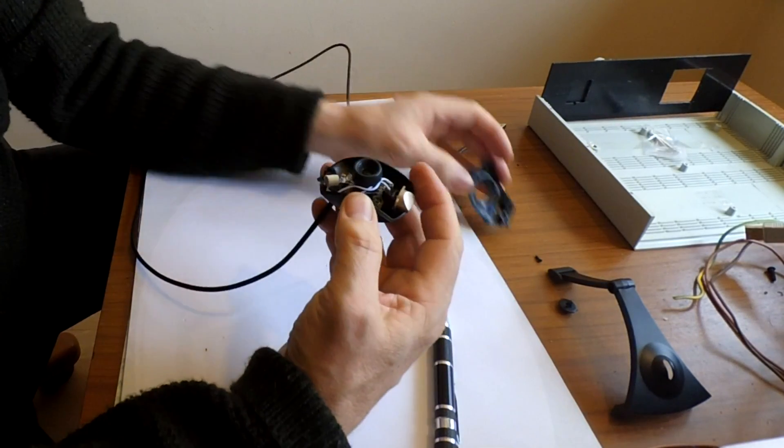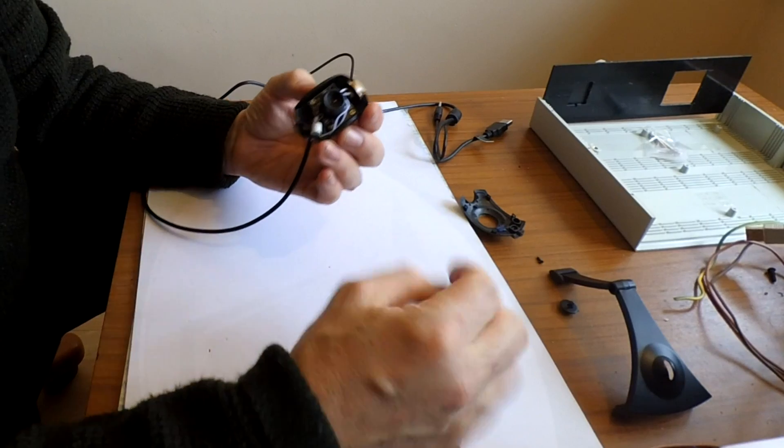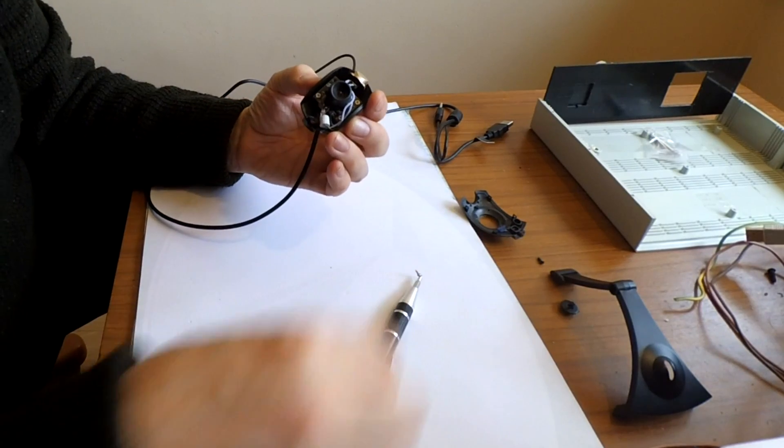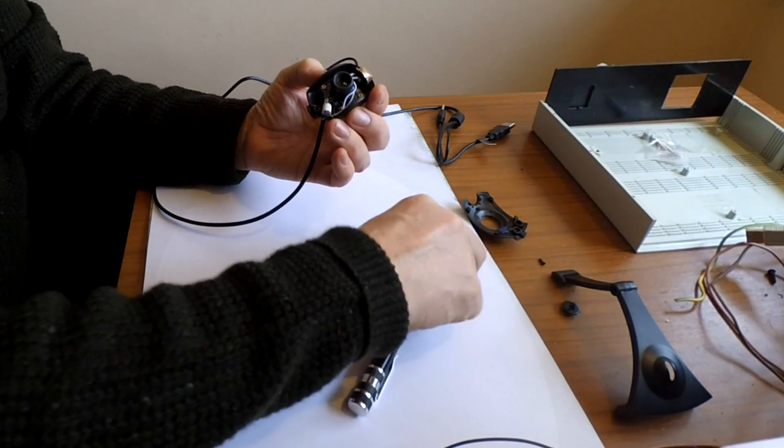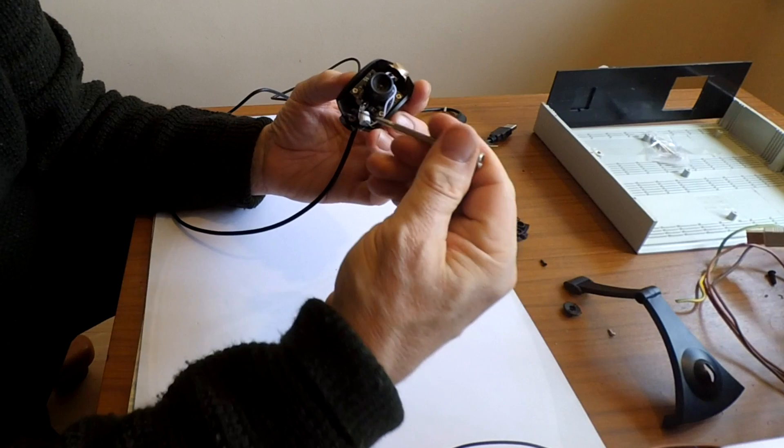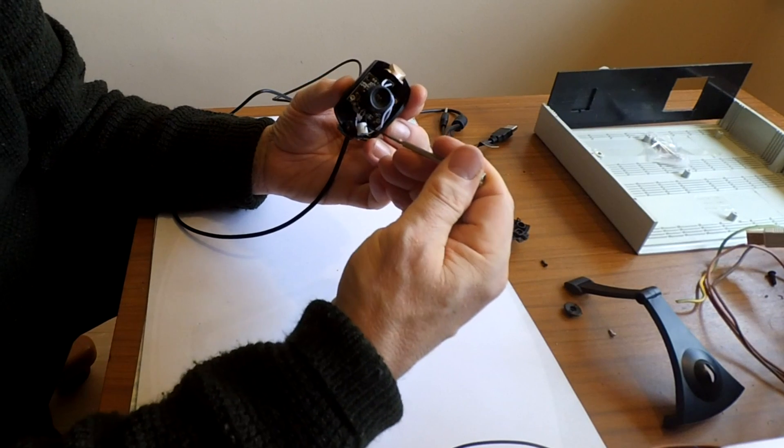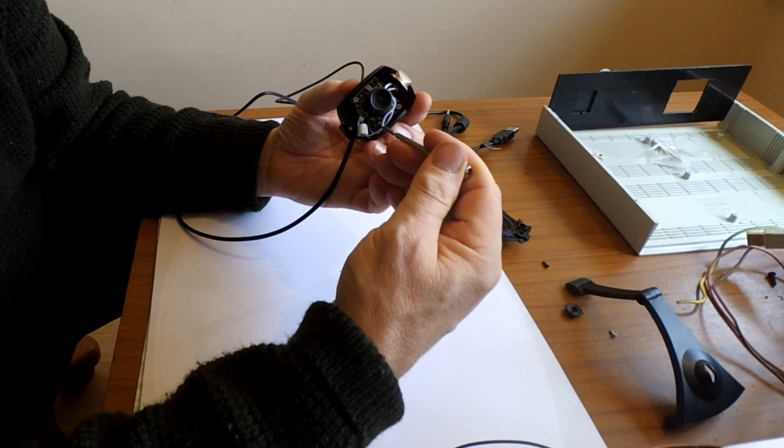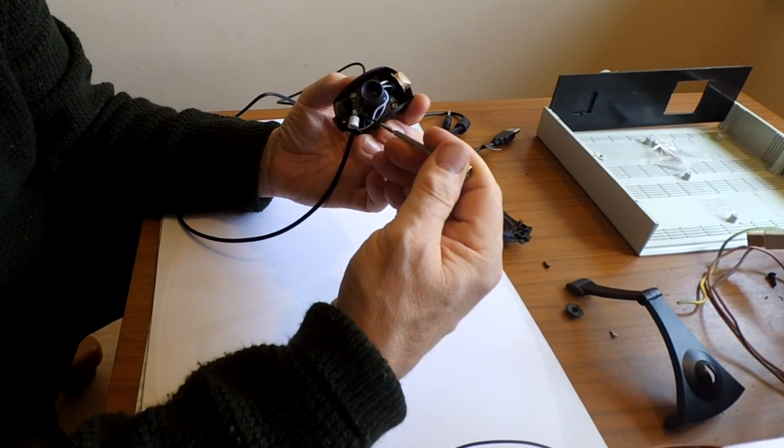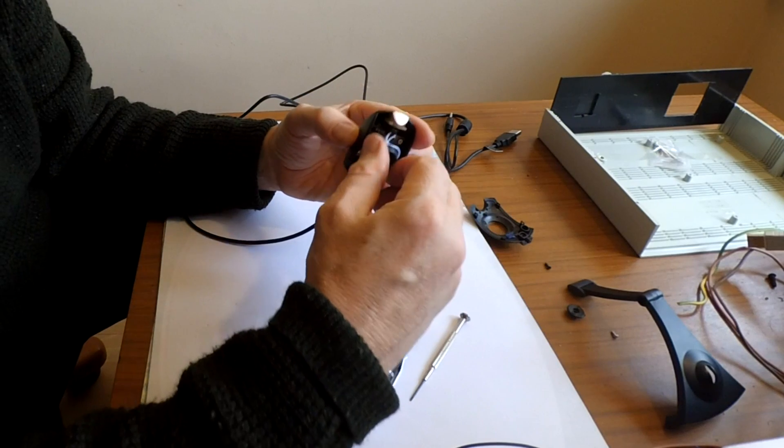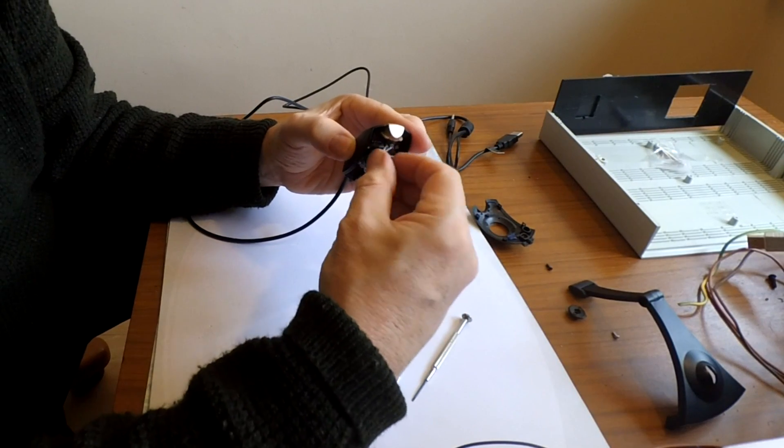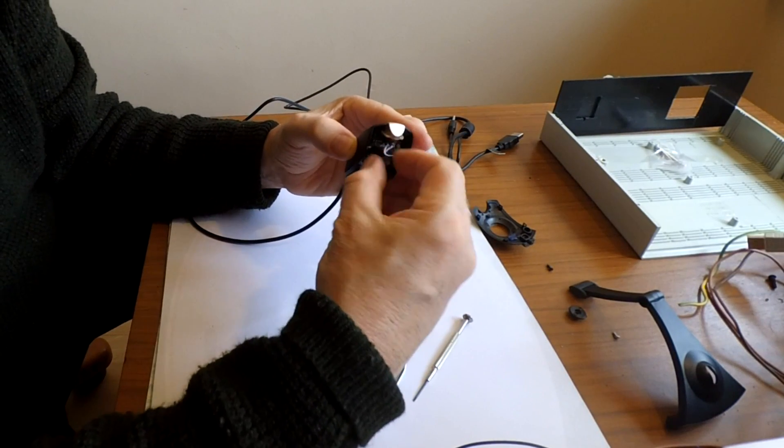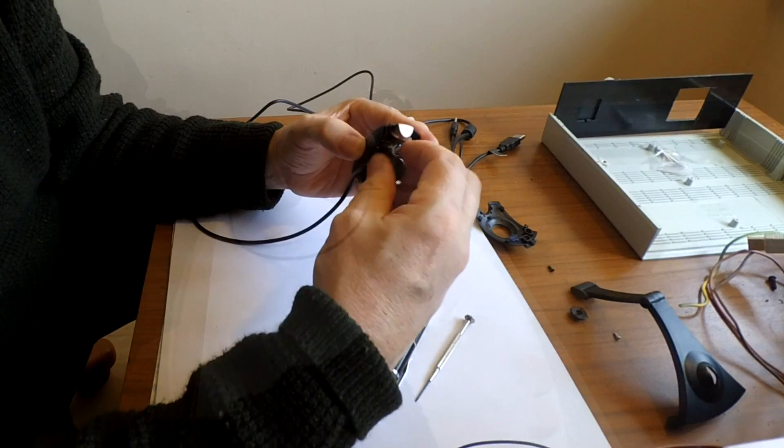Take that off. Okay, so now we can see what's inside. Here's the microphone. This LED will come off. We can't be doing with that. This is the lens on its focusing ring. And that will come apart.